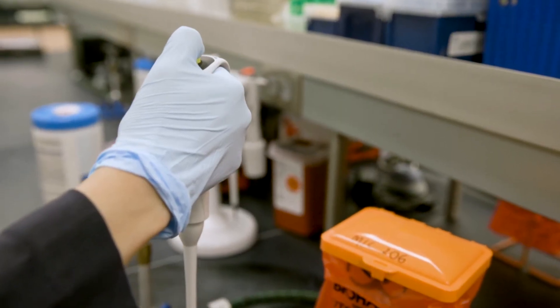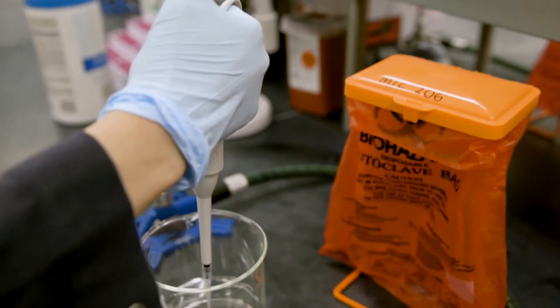press the plunger to the first stop and slightly submerge the pipette tip into the liquid.